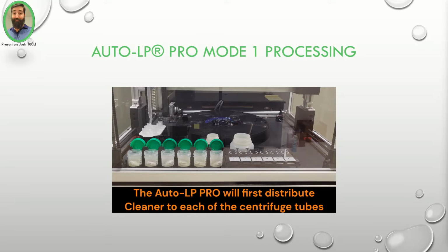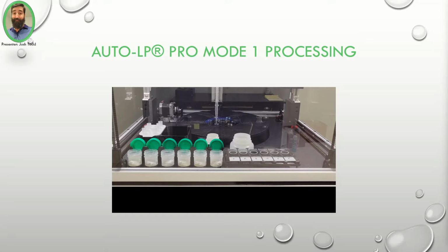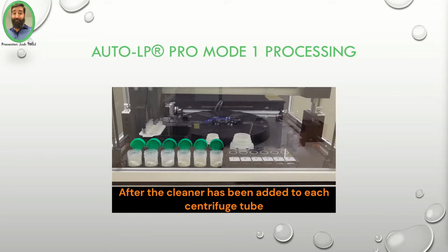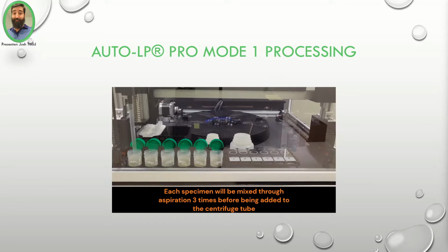The AutoLP Pro will first distribute cleaner to each of the centrifuge tubes in Mode 1. The AutoLP Pro is delivering 1 milliliter of cleaner to each centrifuge tube. After the cleaner has been added to each centrifuge tube, the AutoLP Pro will mix each specimen thoroughly 3 times through aspiration before adding the specimen to the centrifuge tube.